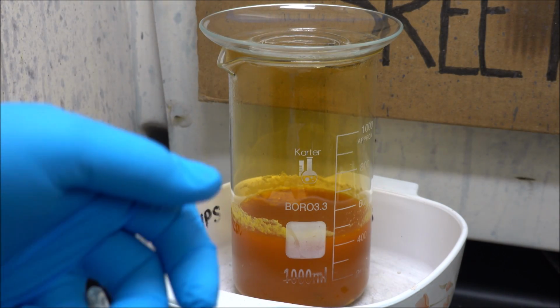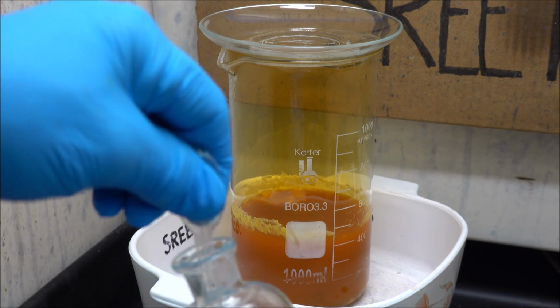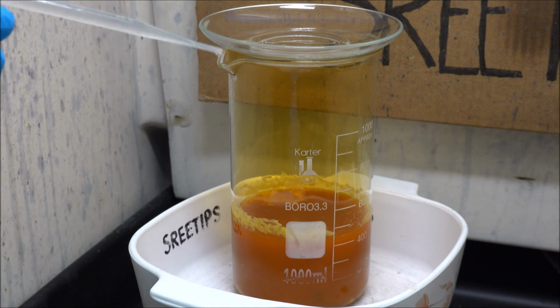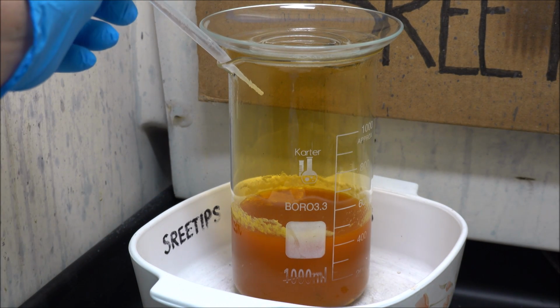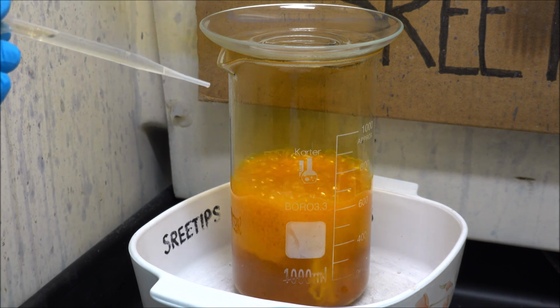Gold has been in there dissolving now about 20 minutes or so. I'm going to add some more nitric here, see if I can light the reaction back off. It's nice and hot, so you've got to add it slow.